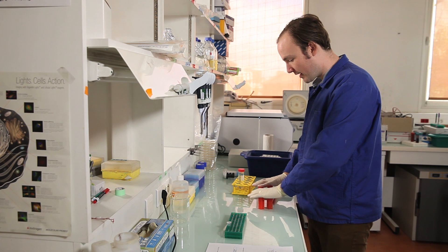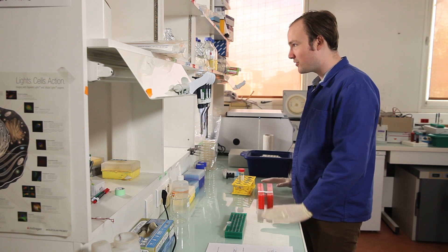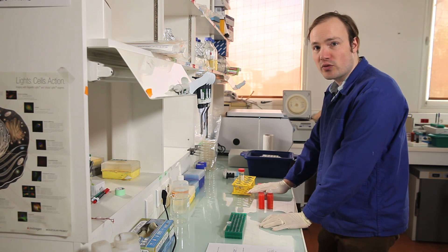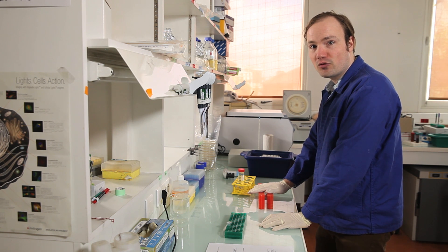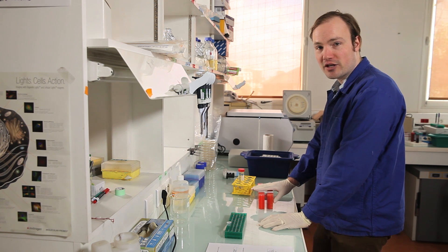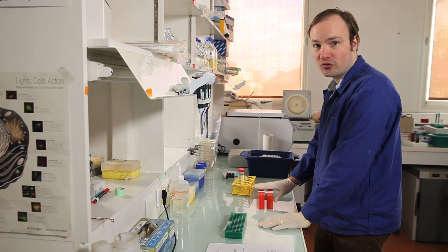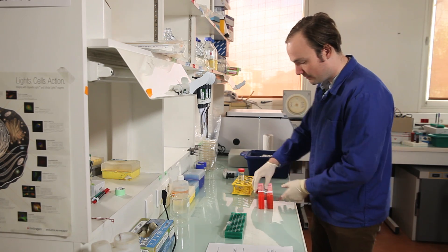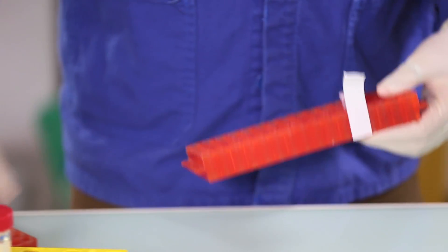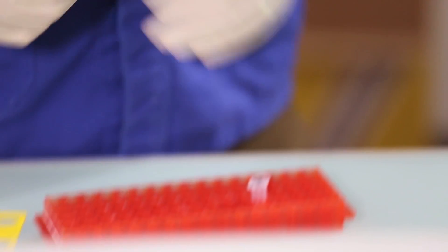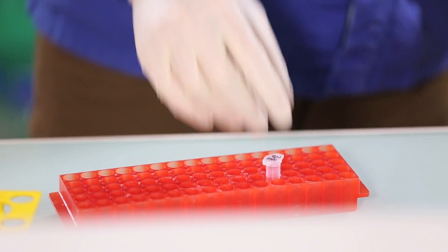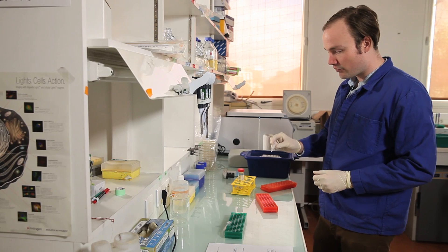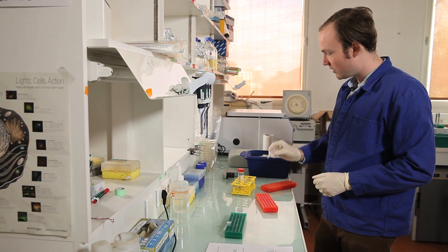Okay. So we're back. The cells are all recovered. The sandwich worked. In this case, we were using a chloramphenicol resistant plasmid. So we recovered the cells for a full 60 minutes in the incubator. So these cells are recovered and ready to use. And all that's left is to plate them.